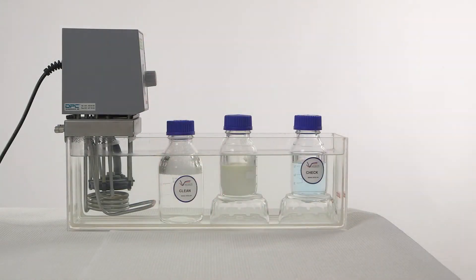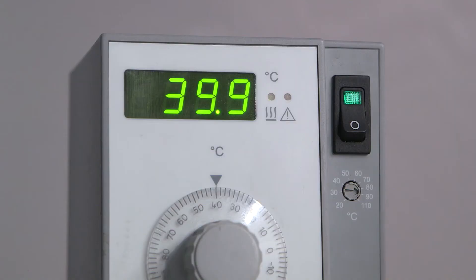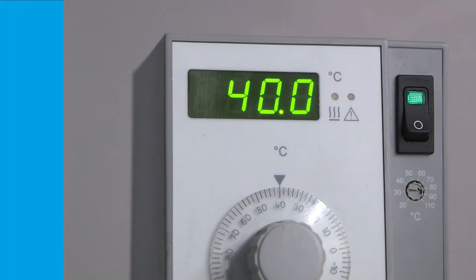For analysis, all samples and solutions must be warmed in a water bath to approximately 40 degrees Celsius and mixed thoroughly.